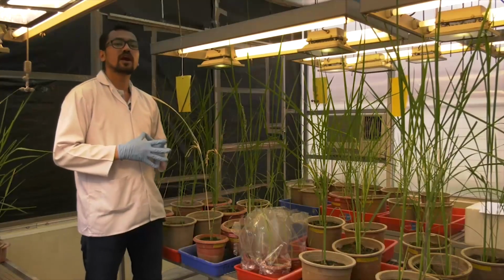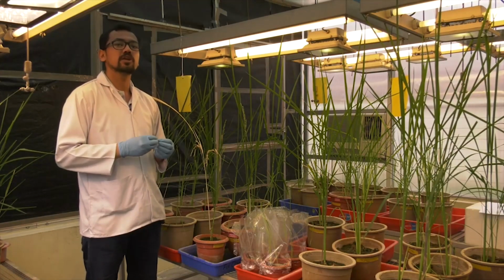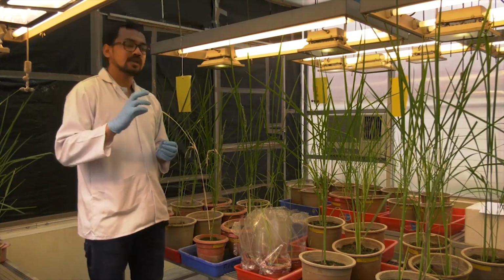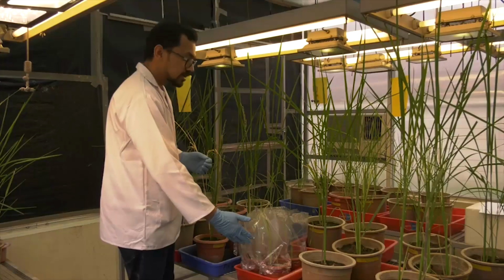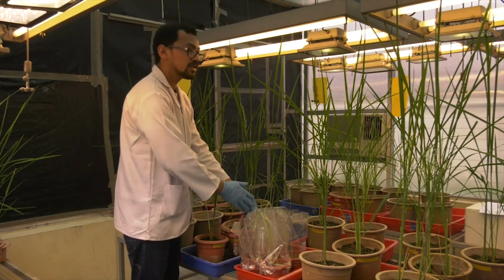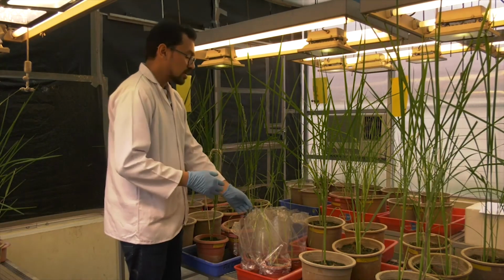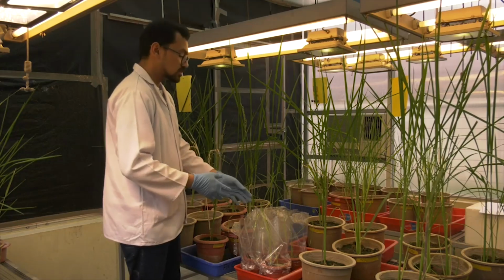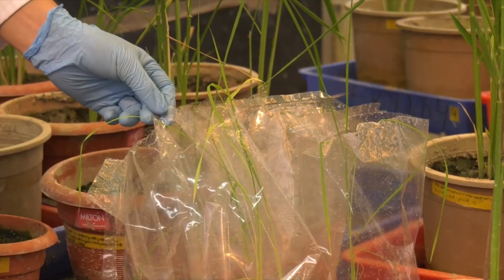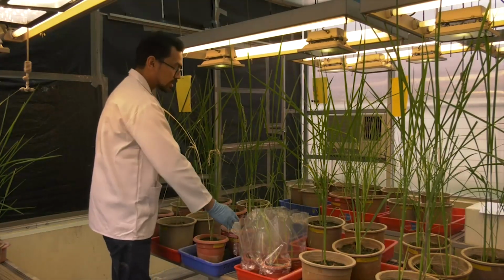The process of hardening is carried out in the greenhouse, where we provide the optimal light, temperature and humidity conditions. The plant that we saw in the bottle is taken in a pot which has soilrite in it. Initially the plant is covered with plastic so that there is 100% humidity, so that the plant doesn't come under stress. After a few weeks, this polythene is cut, as you can see over here, and once the plant is healthy and has good strength, it is transferred into the clay pot.